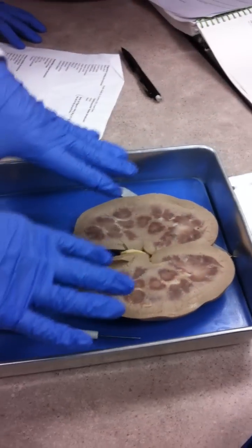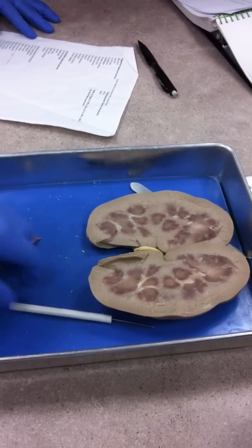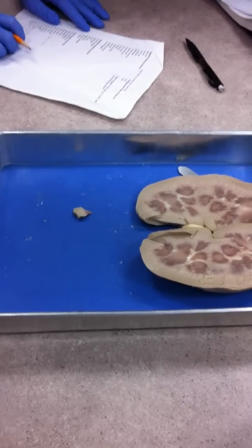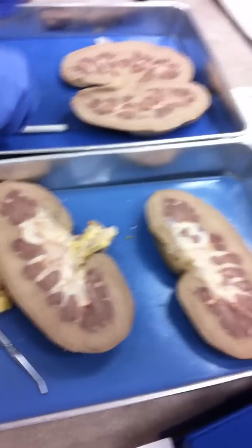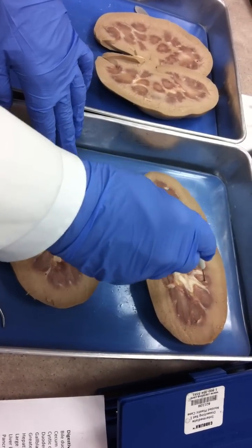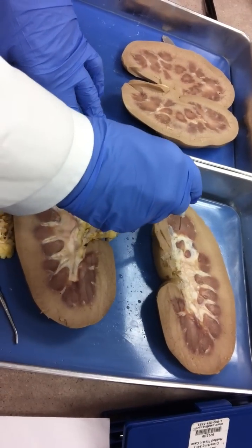That specimen was better for the blood vessels. For the other internal structures, let's use a different one — bring it over. This one is much better. So, this is all adipose tissue, all this white stuff — that's all fat. These dark circled guys are sort of shaped like pyramids. These are all pyramids. If I put a pin here, here, here, all the way around — those are the renal pyramids.